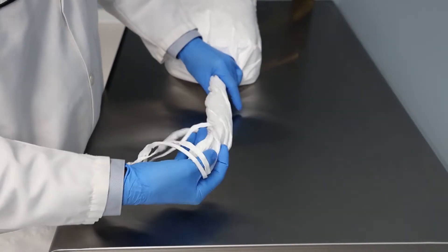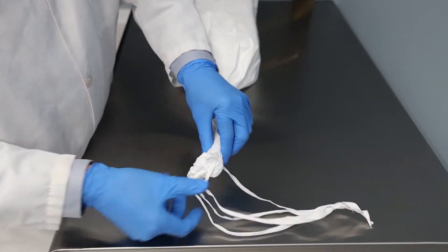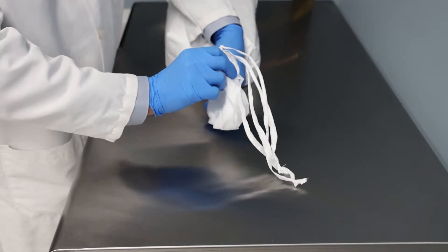Gather the material at the end of the bag in one hand, twist at least one full rotation, and fold over the twisted bag material onto itself.